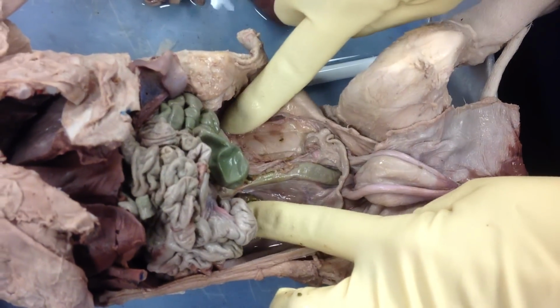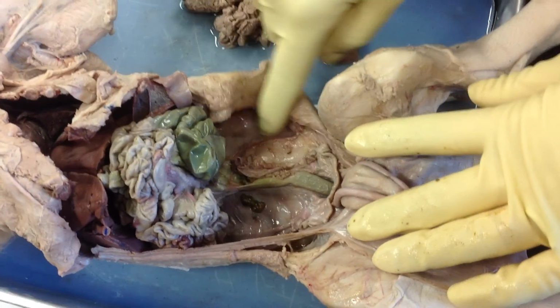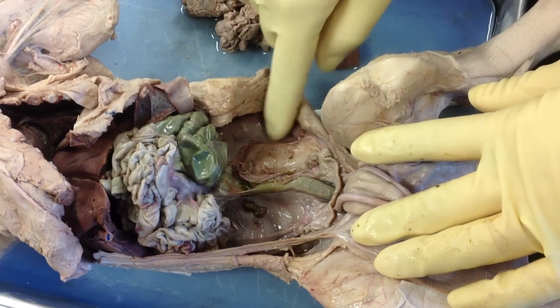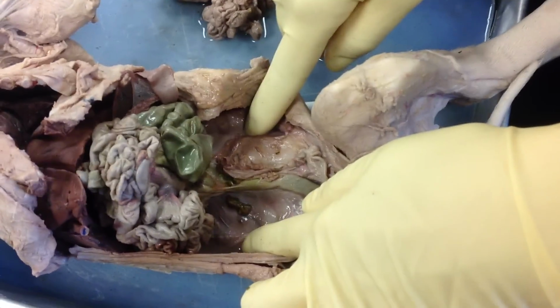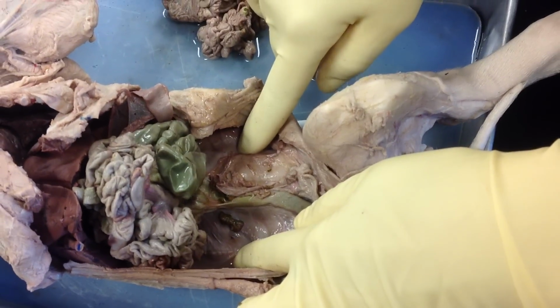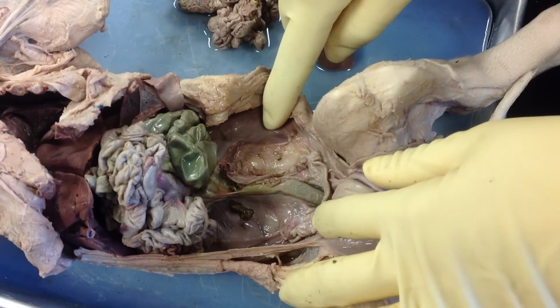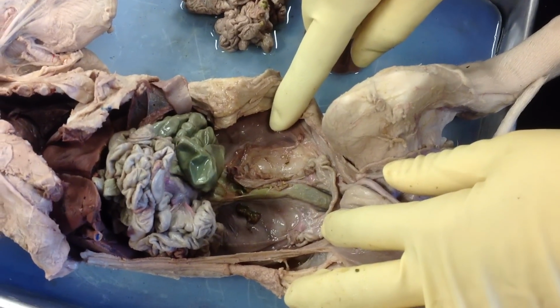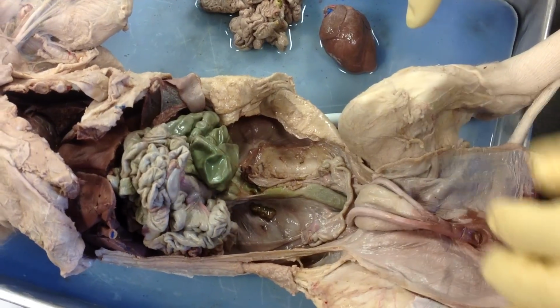And then back here, you can see two structures. They're behind the sac. Remember, I tell you my favorite word is retroperitoneal, which means behind the peritoneal sac. And our kidneys, just like the piggy's kidneys, are located very close to our spine. So back here are two kidneys. Okay, so if I pin a kidney like that, you'll know, in fact, I'm looking for your left or your right kidney. In this case, that would be the pig's right kidney, okay?